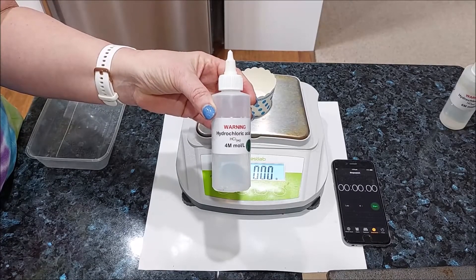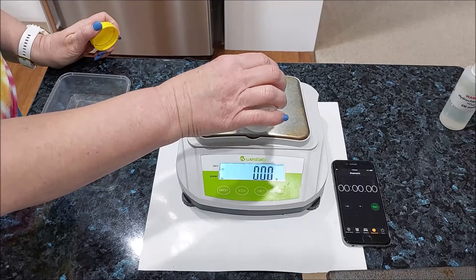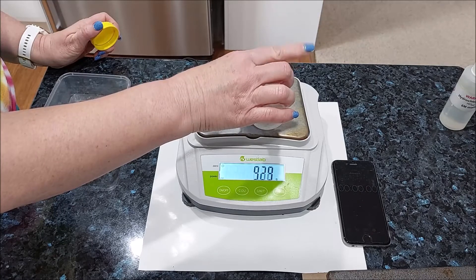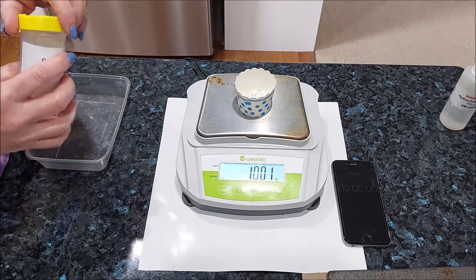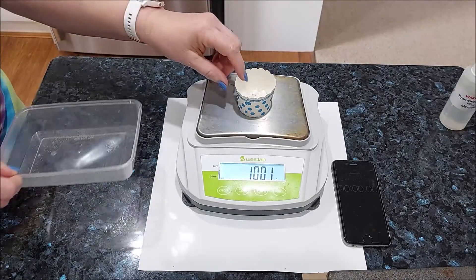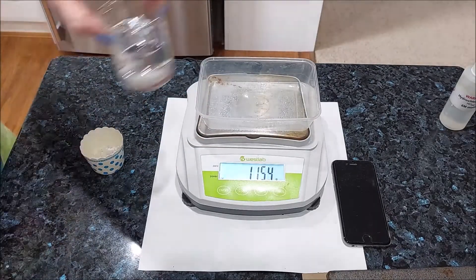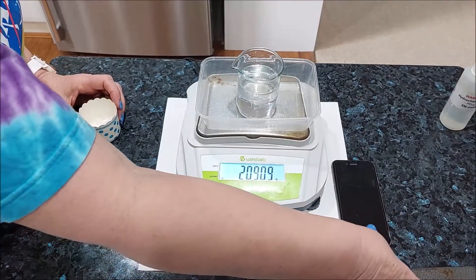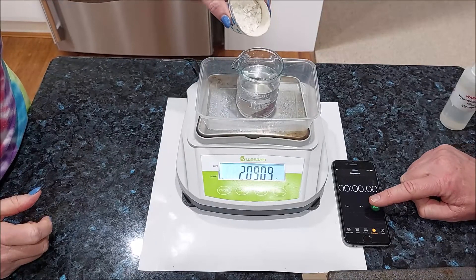4 mole per liter acid this time. Let's measure out our 10 grams of marble chips — 10.01 grams. We are going to add the 10.01 grams to our starting mass. Let's put our plastic tray. Here's our beaker of 4 molar acid. And let's go — ready, set, go.